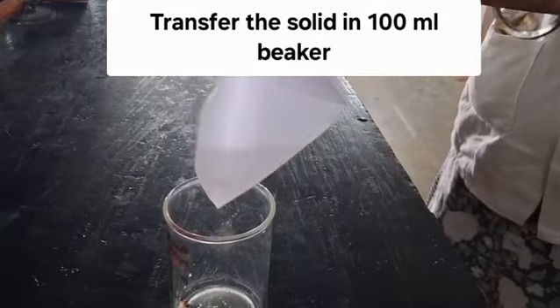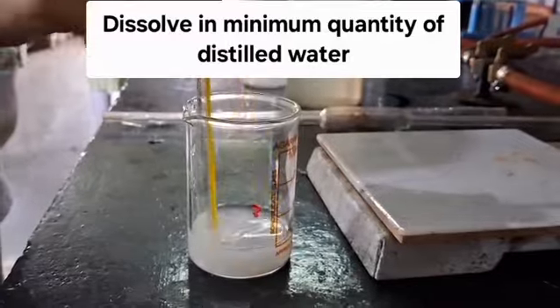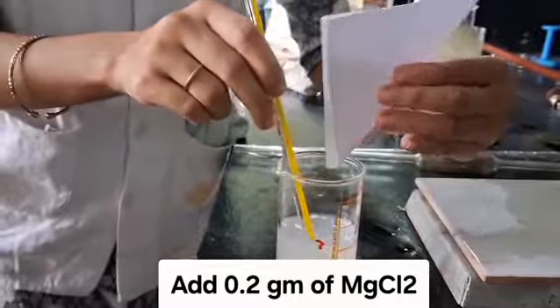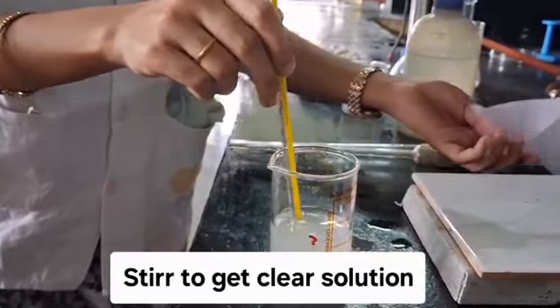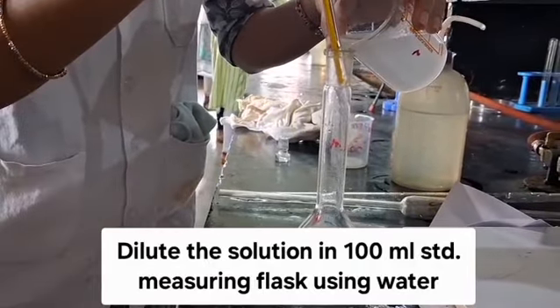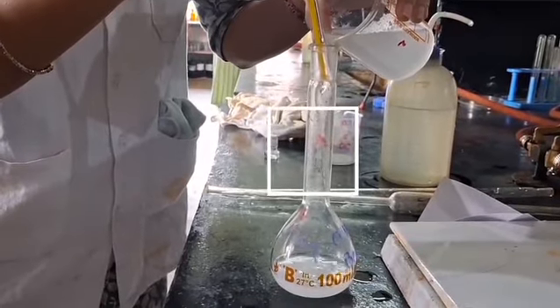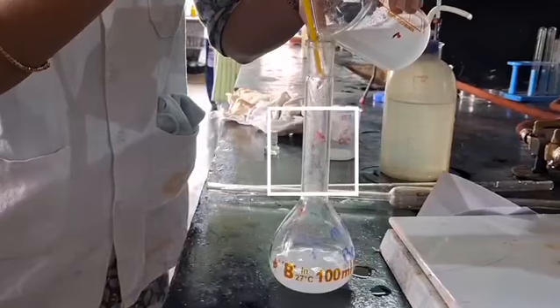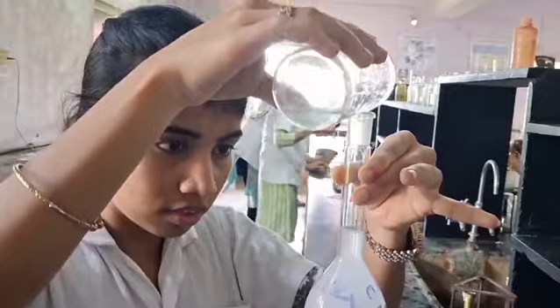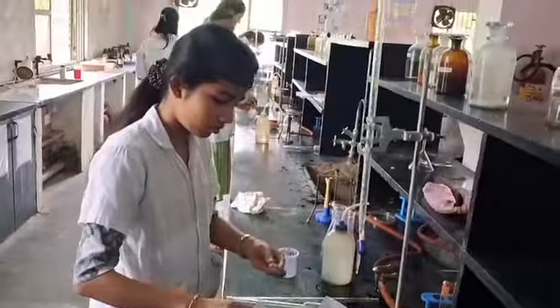For this, weigh 0.745 gram of EDTA. Transfer this EDTA into the beaker. Dissolve in minimum quantity of water. Add 0.2 gram of magnesium chloride and stir the solution to get a clear solution. Dilute this solution into the 100 ml standard measuring flask up to the mark by using distilled water to get 0.02 molar EDTA solution. Fill the prepared 0.02 molar EDTA solution into the burette.